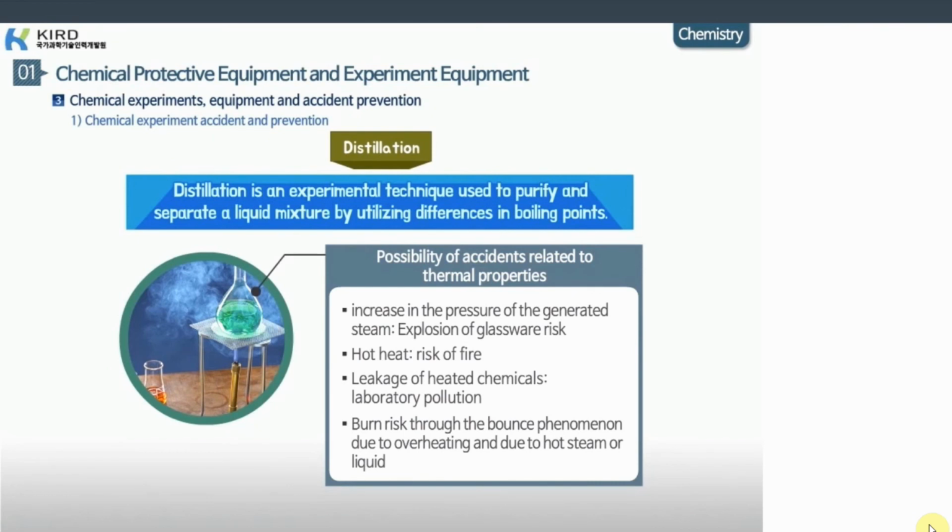First, there is a glassware explosion risk due to the increased pressure of the generated steam and a risk of fire from the heat. There is also the risk of laboratory pollution and leaks of heated chemicals. There is a burn risk through the bounce phenomenon due to overheating and due to hot steam or liquid.